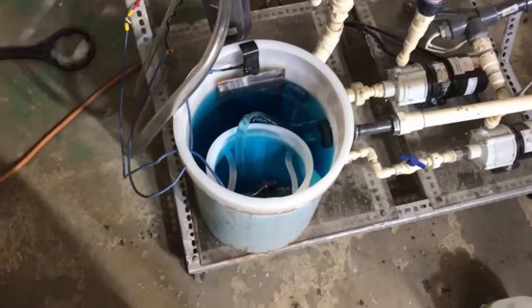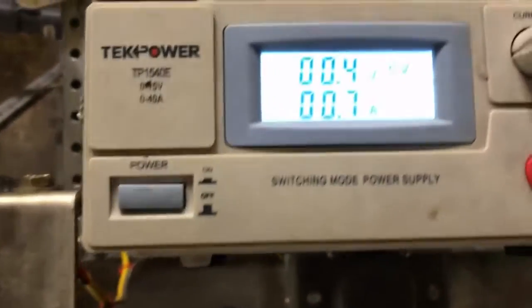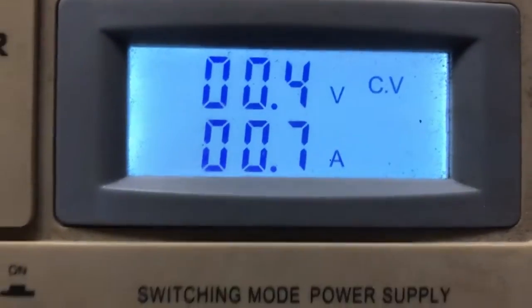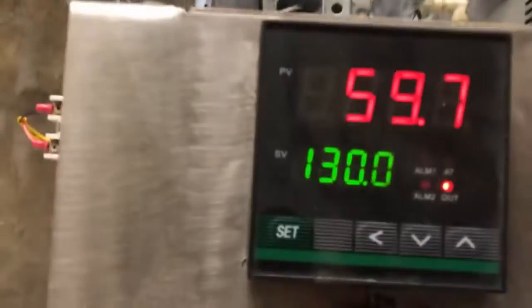I just now fired this cell back up. The anode is in place, and we're already starting to get a little copper plated on here within just seconds. To ensure that all of the copper is removed from the anode and we don't end up with a bunch of copper in our anode sludge, we're going to keep this voltage at about 0.4 volts. The temperature is slowly increasing — we have the heater on and we're going to be bringing this up to 130 degrees Fahrenheit. The amperage will slowly go up as the temperature increases.